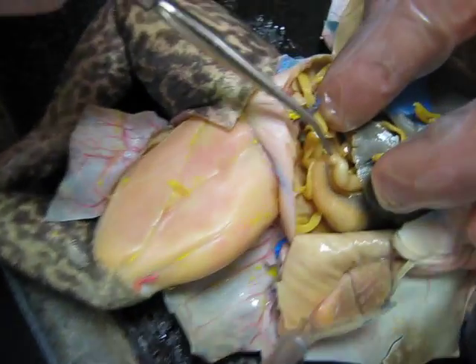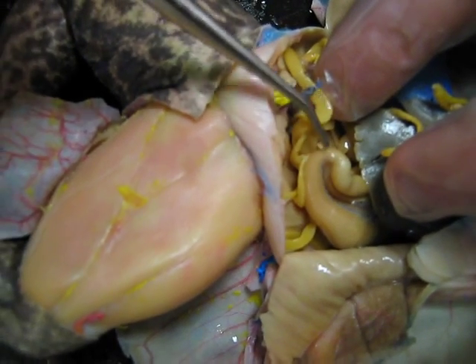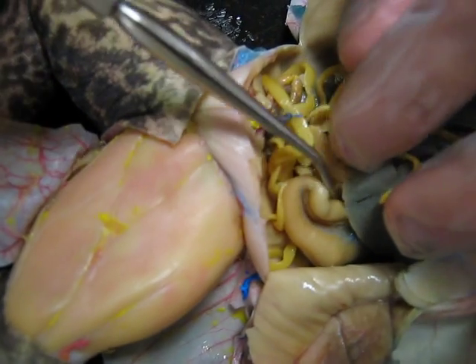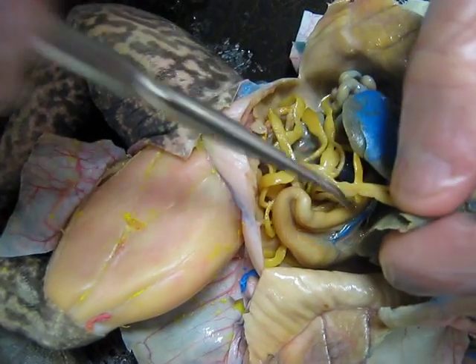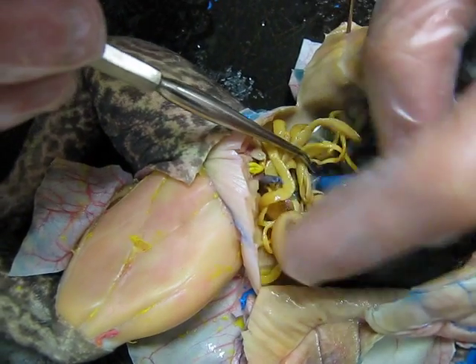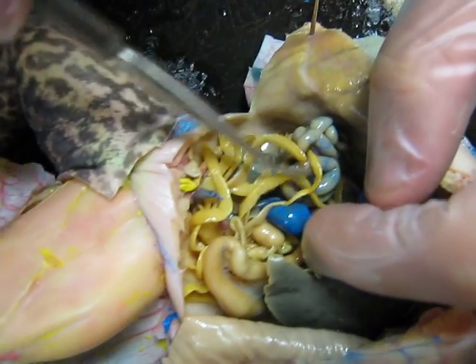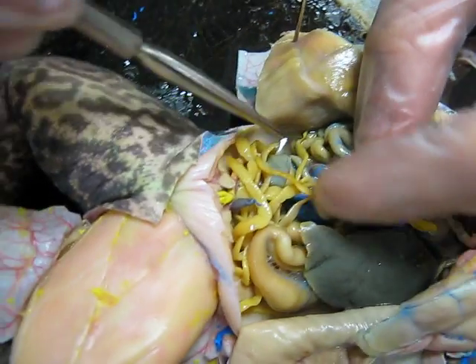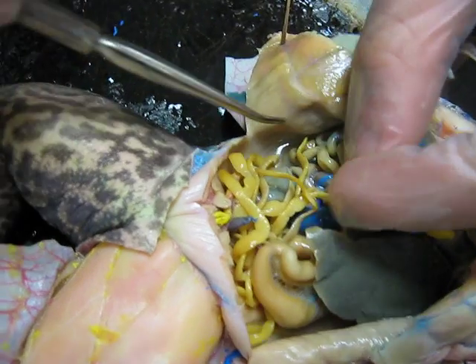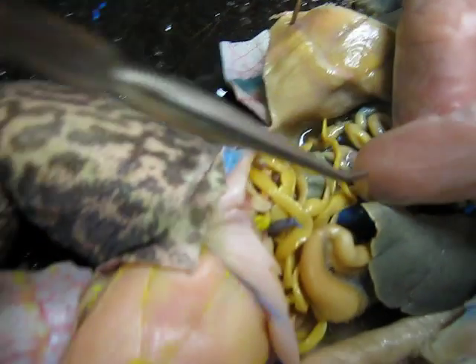You see this dip here — this is the pyloric valve, which separates the stomach from the duodenum. The duodenum is part of the small intestine. The duodenum comes along here; the ileum is the thinner portion, and the duodenum is the thicker portion.